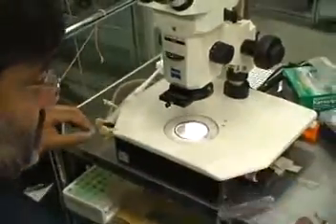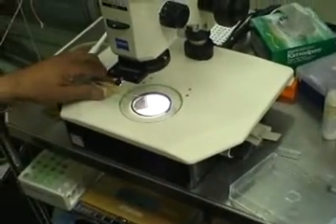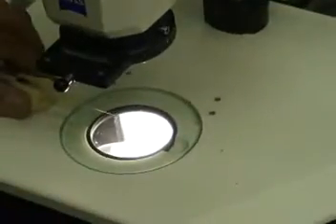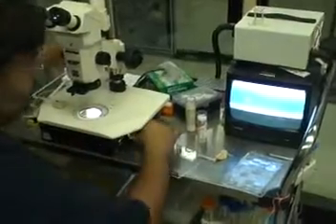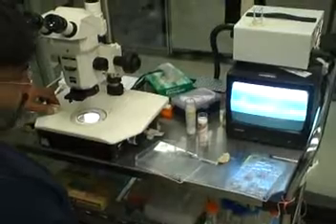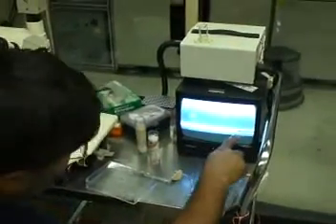Now I'm going to put it in my little clay. Here is the clay, carefully. My column is still there and I'm going to put it in the microscope. Now I have a stable mechanism here and the column is moving so I have to be careful. The crystal is placed here — that's the crystal right there in the column.